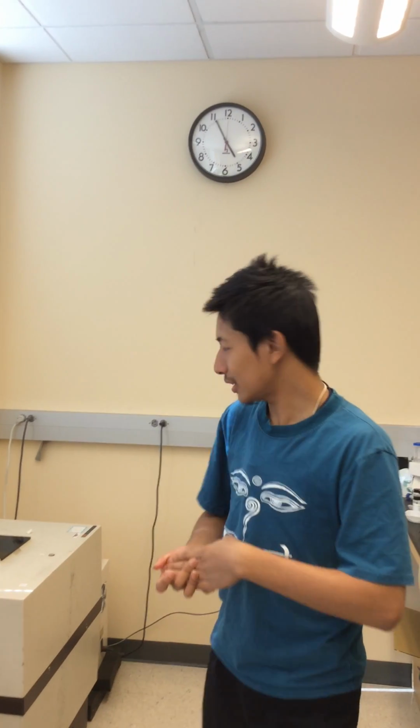Hi everybody, my name is Manohar Pradhan and I'm a chemistry major here at Westminster College. So today I'll be talking about the basics of how to use an NMR and how to obtain a spectra.